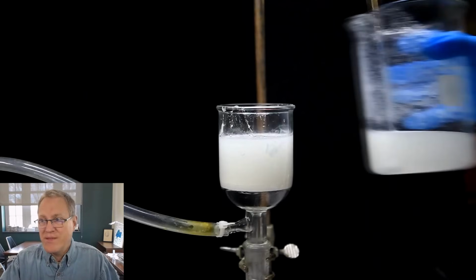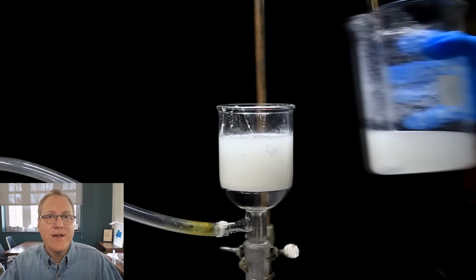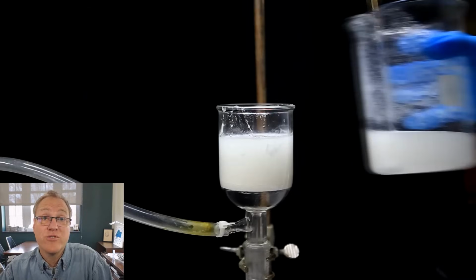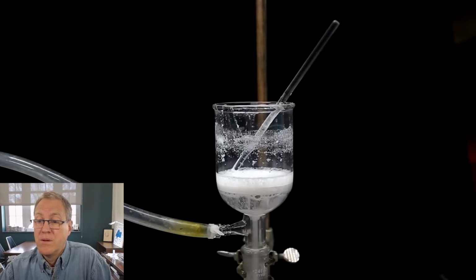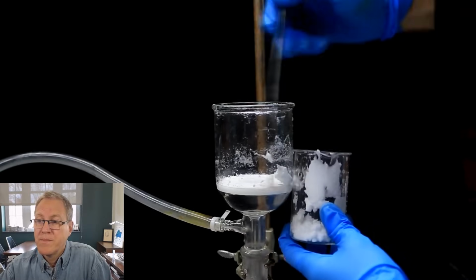He's getting some out of his precipitate solution. He gets some, he then does a rinse, pulls that out of the funnel, and then he does some more. So this is probably a pretty tedious process. Probably took quite a while to do. We do it exactly the same way that we just did it, and we keep repeating it until everything in the beaker is filtered. We keep doing this, and we're left with a decent amount of wet lidocaine.